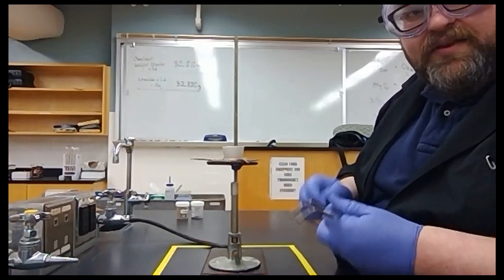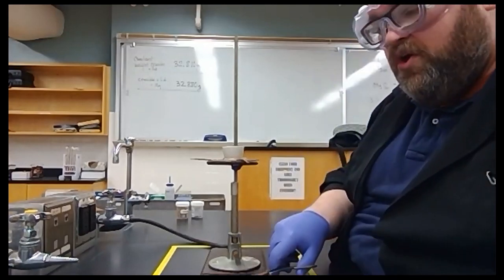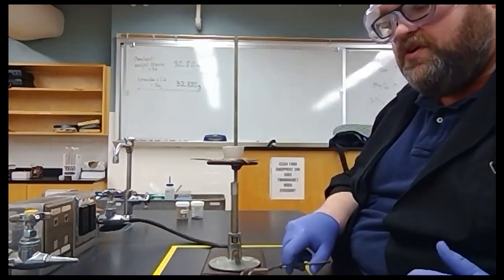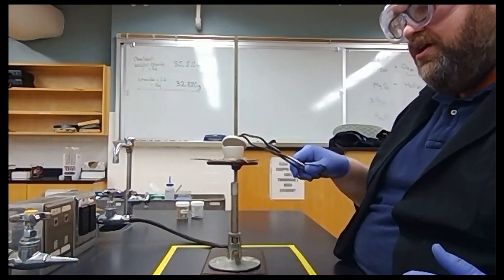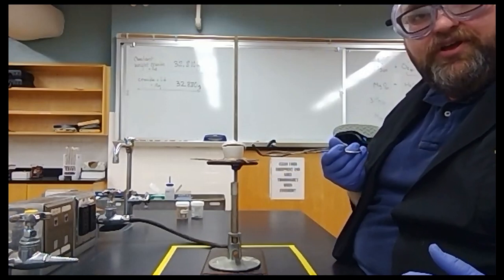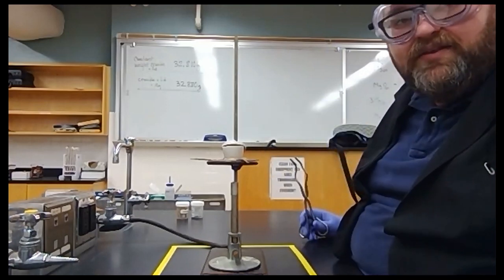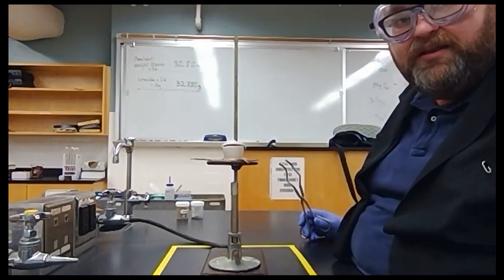Now, when the magnesium ignites, some of the ash from the magnesium is going to try to fly off. We need to catch that, but we still need oxygen exchange. So we can't just set our lid on tight. We need to, again, put our lid on sort of at an angle. That's going to give airflow to the magnesium, but still trap all of that magnesium ash, the magnesium oxide ash that may fly up away from the magnesium.